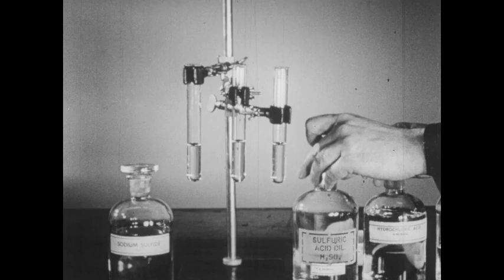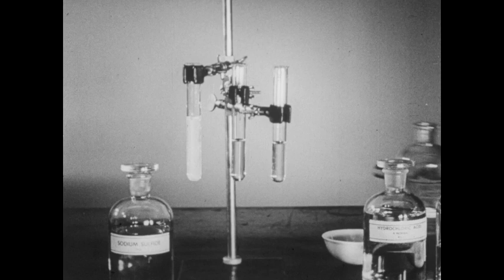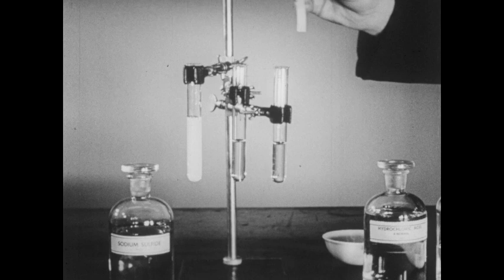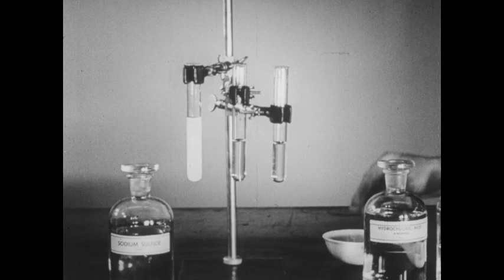To the tube on the left, I'm going to add a few milliliters of dilute sulfuric acid. You'll notice that a gas bubbles from the solution, and when we lower a piece of lead acetate paper into the region above this tube, the lead acetate paper turns black. This is a test for the presence of hydrogen sulfide.